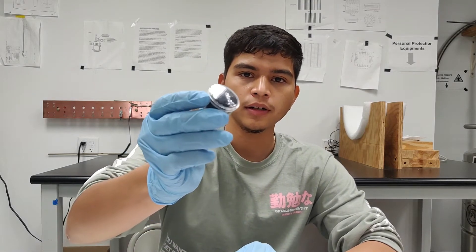Alright, so next we get bulk MOS2, which I have here. And you place it on tape, which I have already done.